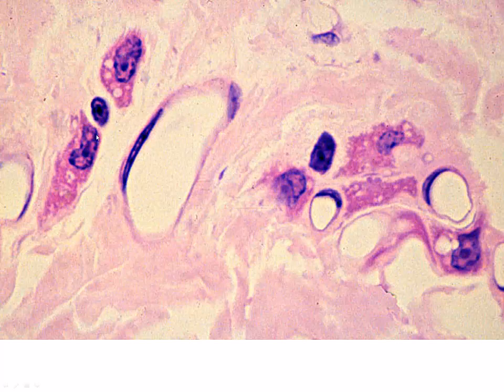But as we look at the cells in this field, we've got these really dark round staining cells, probably a lymphocyte, but these are the ones that we really want to focus on. Not quite as blue staining, large oval shaped nucleus. I'll give you a hint, you can imagine sort of an indentation in the nucleus, but what I really want you to see are these bubbles, this soap bubble-like appearance. These are the vesicles, maybe phagocytic vesicles. These are macrophages, resident macrophages in our connective tissue, and that's how they're going to look in a high magnification.